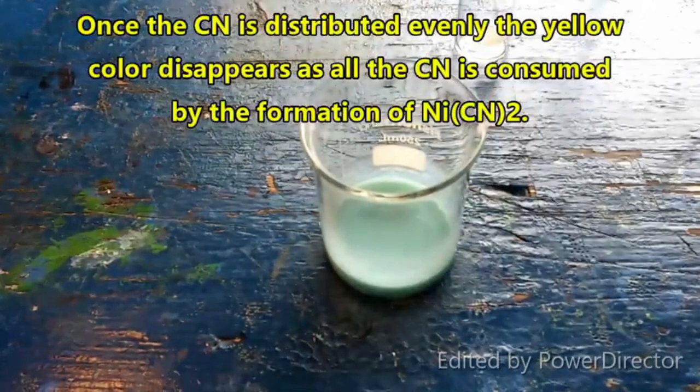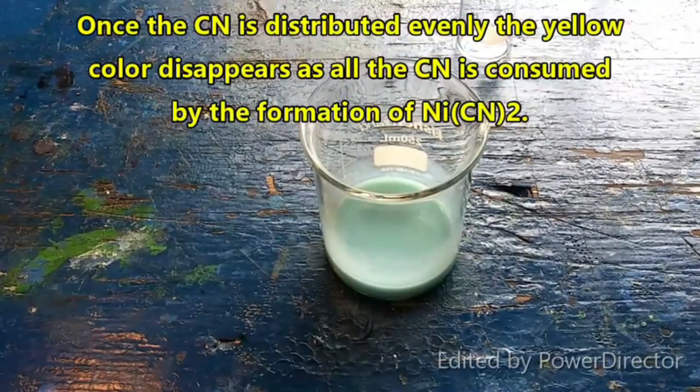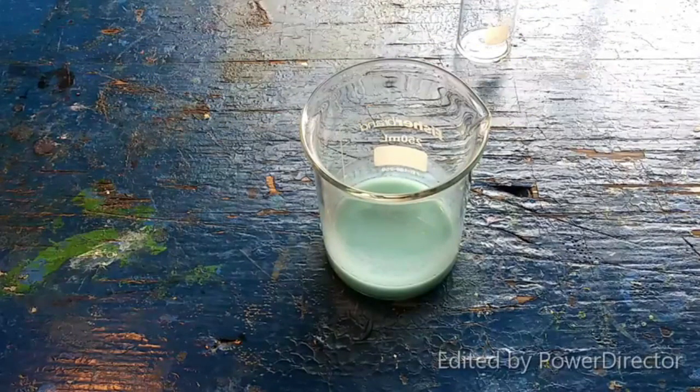And there we go. You focused? I don't have a whole lot of cyanide in my inventory, so I can't repeat this, so stay focused.